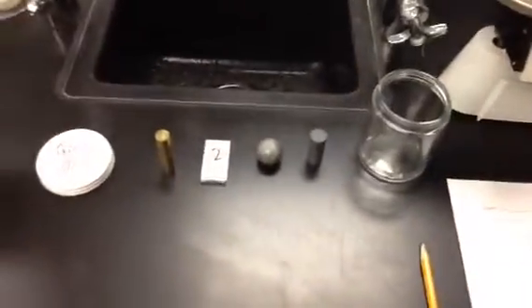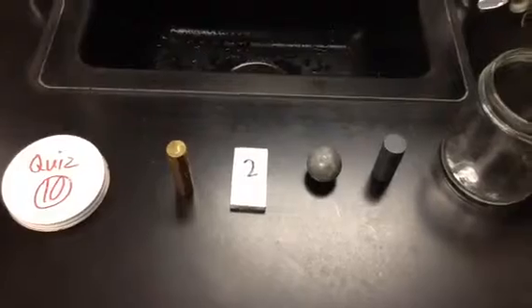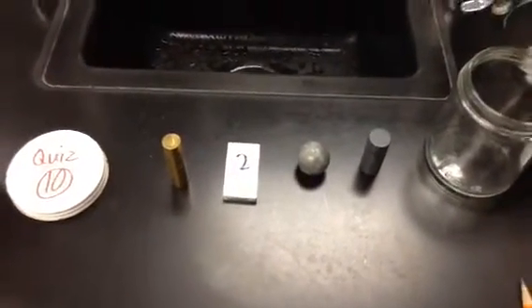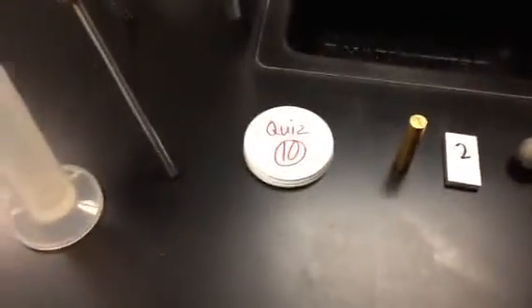The first thing you're going to want to do is take the 4 materials out of your jar, or take one out at a time, and notice that they will have numbers stamped on them. I wrote on the square piece you see there, and the gray piece. Some of the pieces may look familiar to you, some of them may not. You will notice that on your jar, on the lid, there is a number. It's hard to see here with the glare.